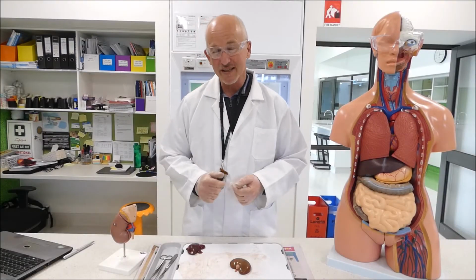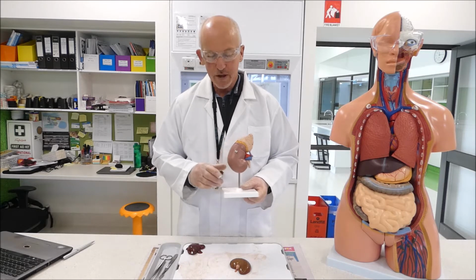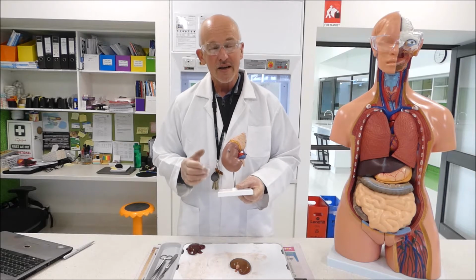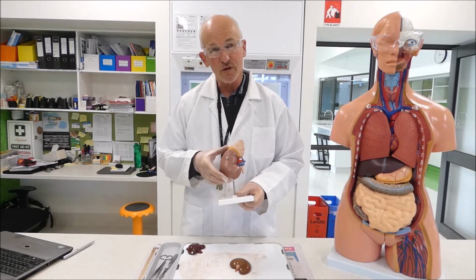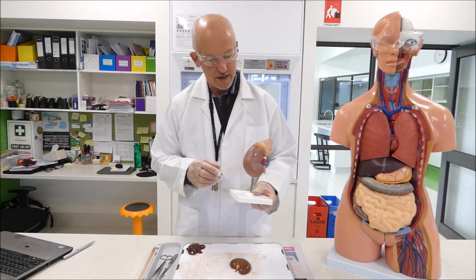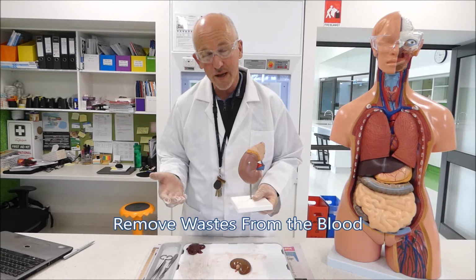So today's topic is the kidneys, and the kidneys are a really important organ in our body. We're going to be looking at the kidney today, dissecting it and looking at the structures, of course. Now the kidneys are a bean-shaped organ, and we have two of them in our body. They do a really important thing for us. They remove waste from our blood.